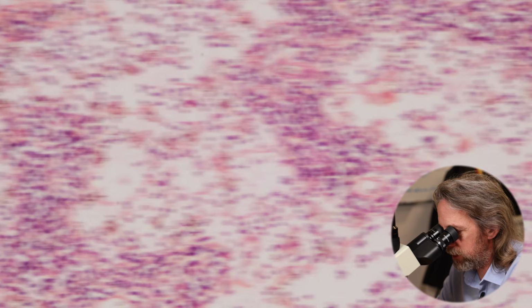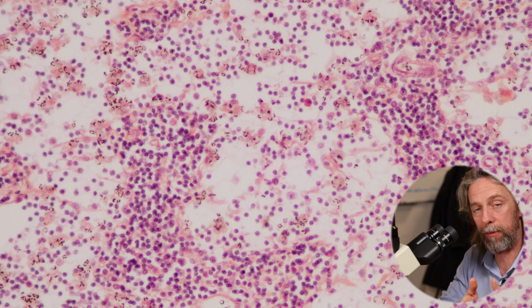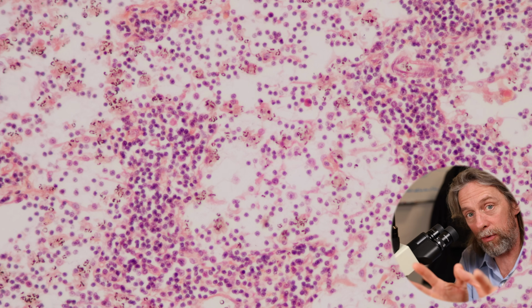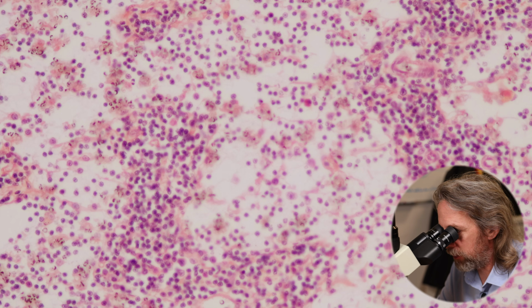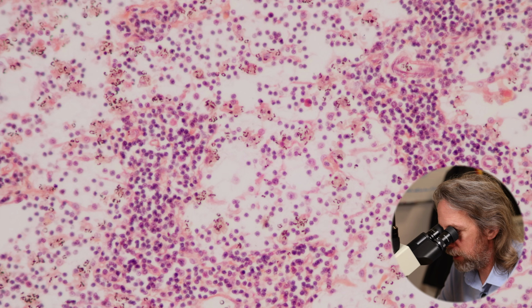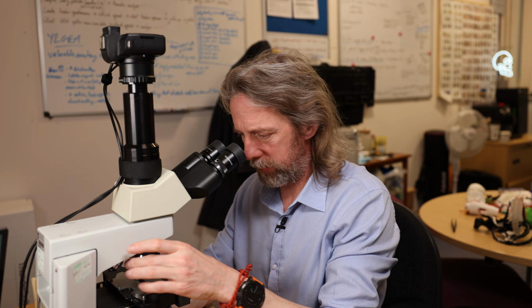Yeah, and we just can't see it in this plane of section, but that fluid is eventually going to make its way to the hilum of the lymph node and leave through efferent lymphatic vessels, which will probably pass to other groups of lymph nodes, and then other lymphatic vessels, and then eventually back into the blood. But there you go. How's that?